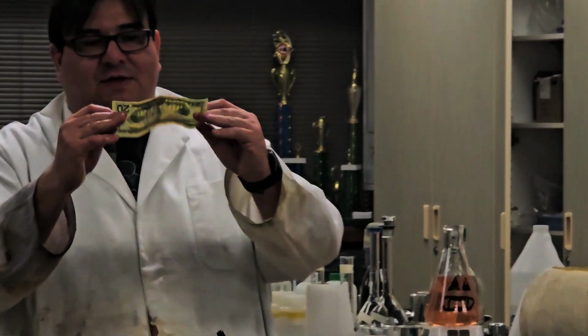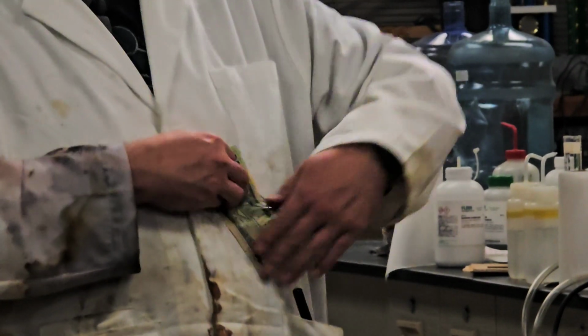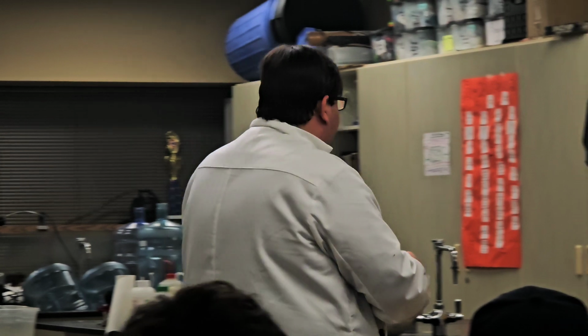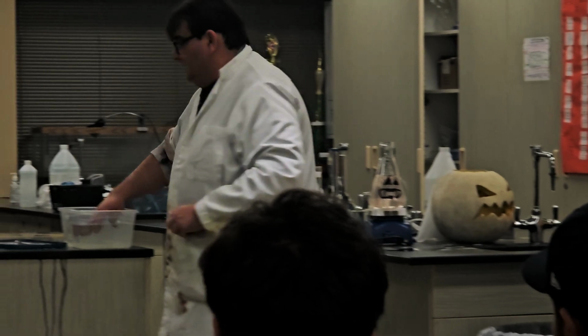Okay, so if you look, other than now Mr. Single's money's just really, really wet, and now mine, it's completely fine, okay? Which again shows you that it's not the liquid that's burning, it's the vapor coming off of it. And because we have the vapor coming off of it, we can do something else then.